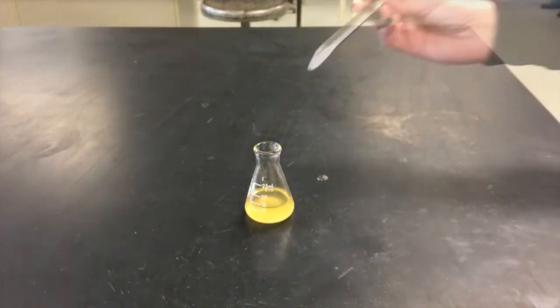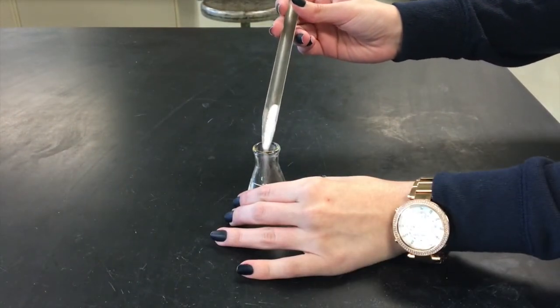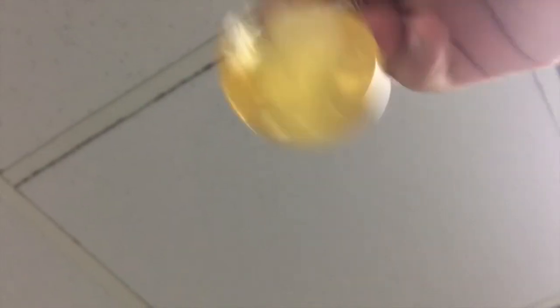Next, we're going to have to remove any remaining water using a drying agent. Remember that the exact amount of drying agent you need is different from person to person. So add some in and swirl it around. If it clumps together, then you're going to need to add some more. It should go from murky to clear, and at least some of the drying agent should act sandy when you swirl it around.